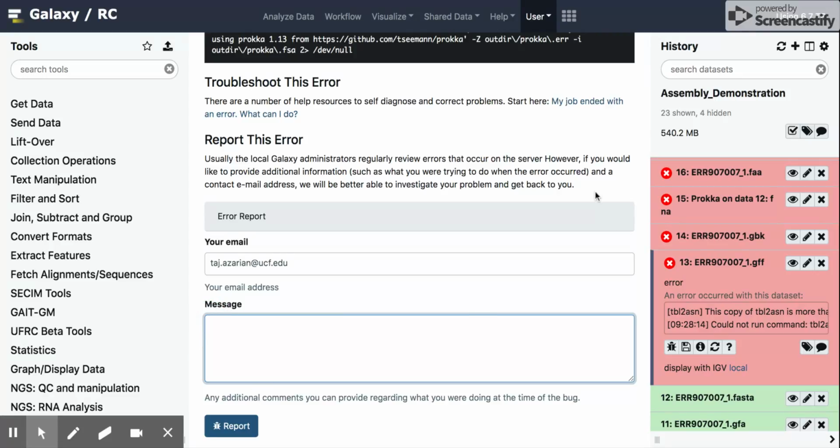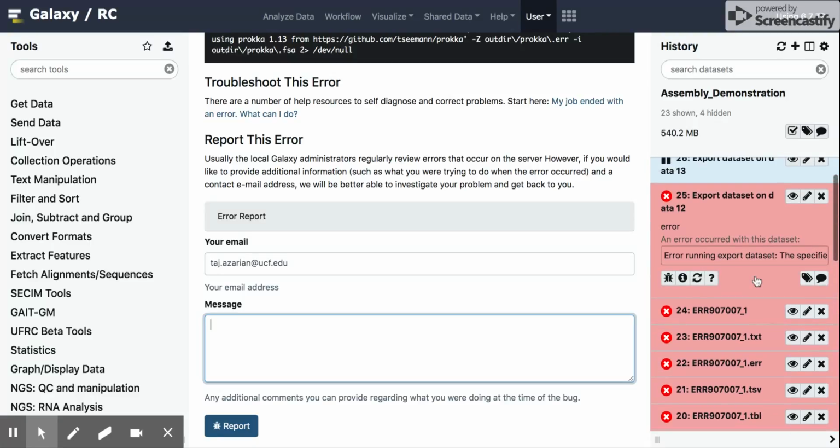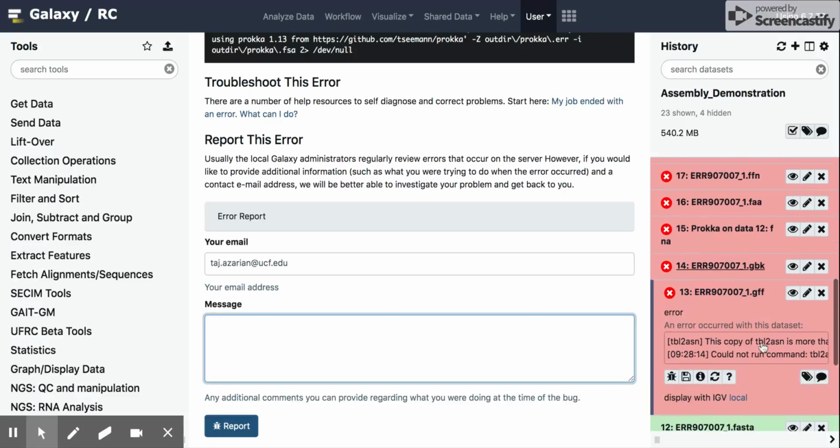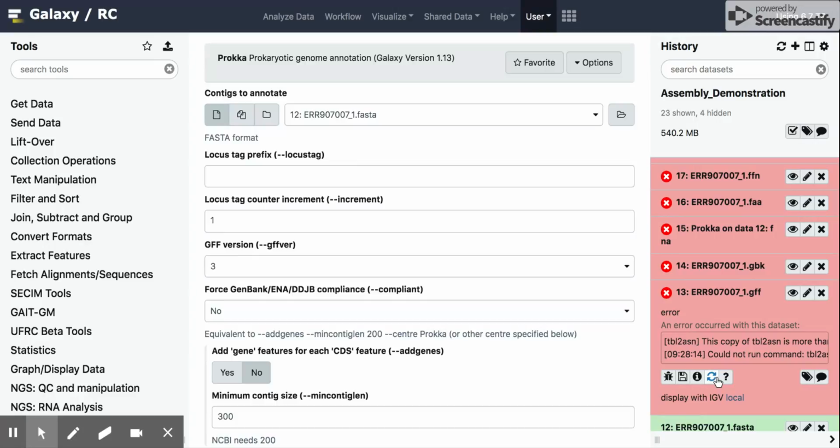Now, I know that this has been updated, so one of the things I can do is say, okay, I know the program's working correctly now. How do I restart it and then continue on with the rest of my pipeline? The way to do that is with these little double arrows right here. If you click on this, it says run job again.